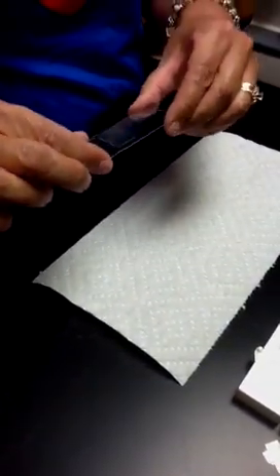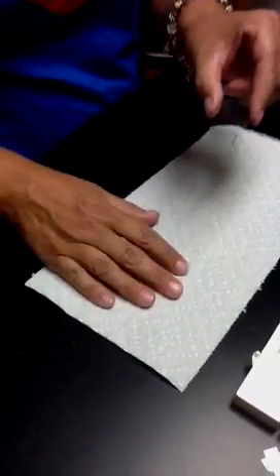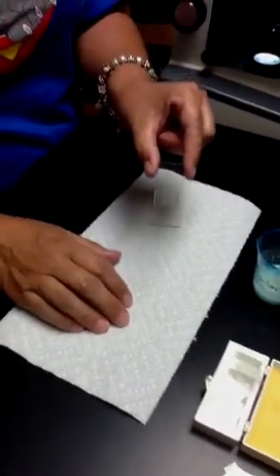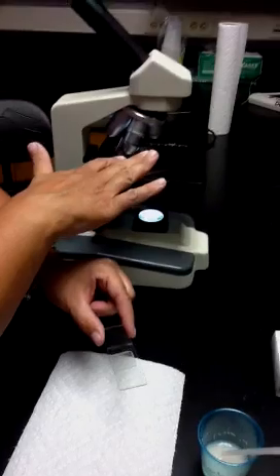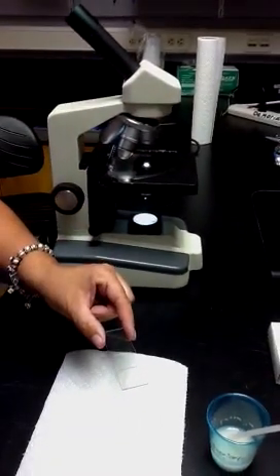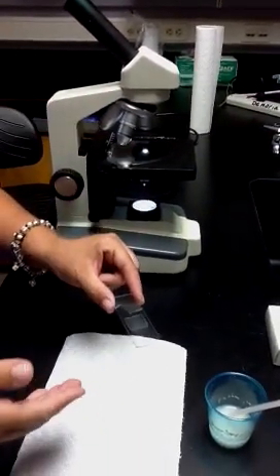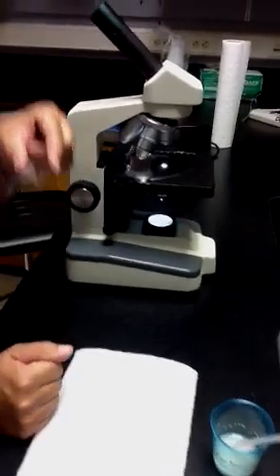I don't have a lot of liquid leaking off the side of the slide because we do not want to mess up or get any of our lenses or the microscope messy because then it's very difficult to observe specimens.